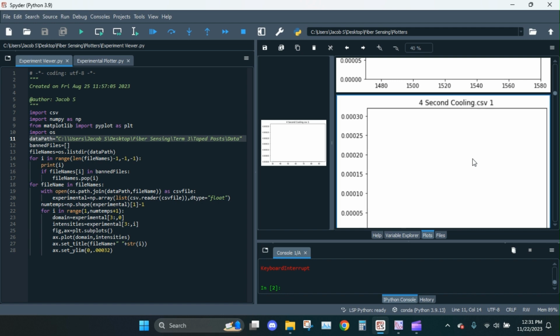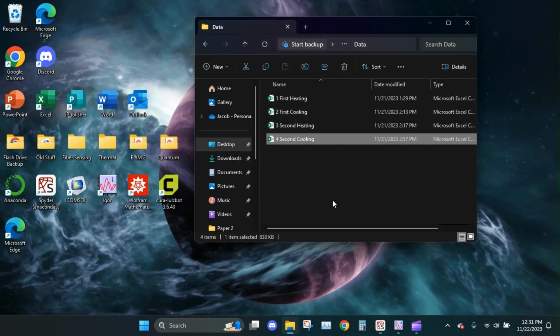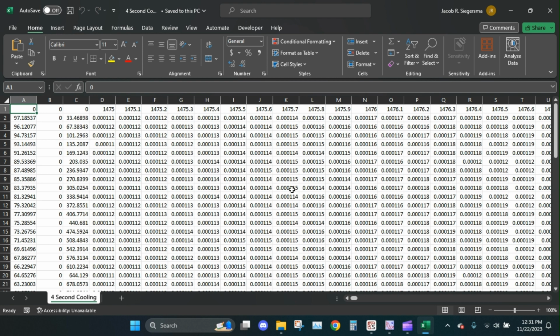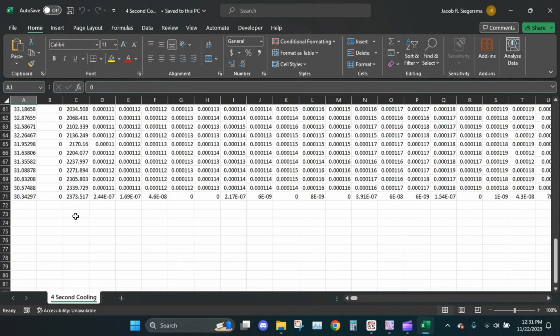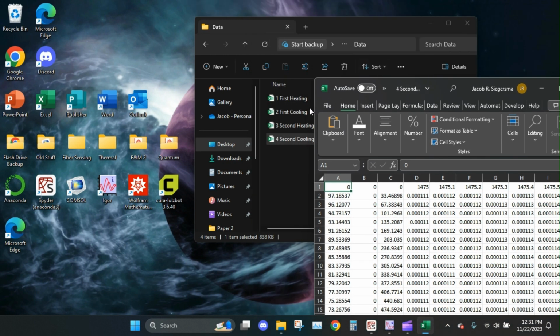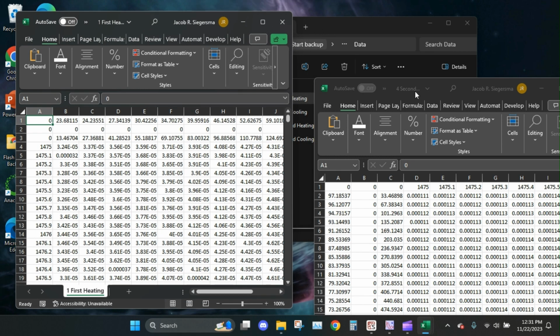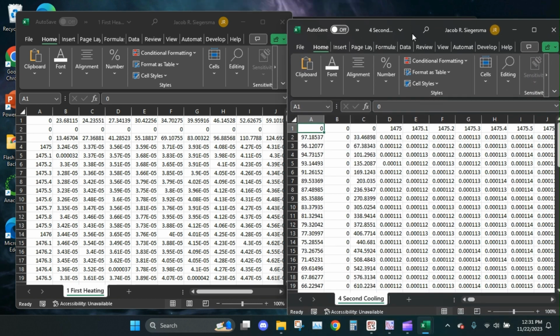I'm going to close all of these plots because that's a lot of RAM. Let's open up second cooling, see what happened there. Yeah, I don't think this... Let's compare it with one that worked. Yeah, see, I don't think this one was saved correctly.